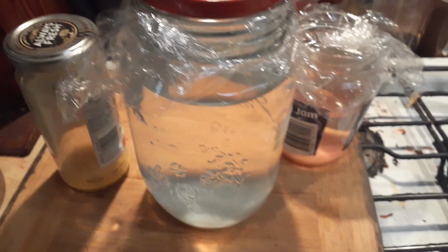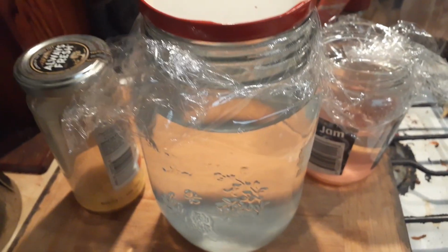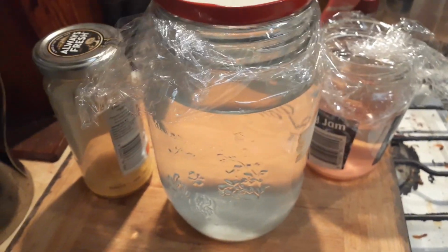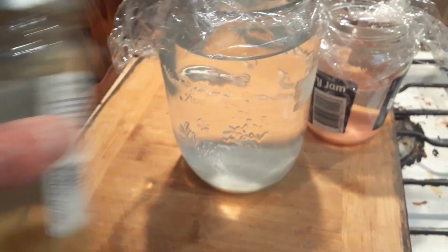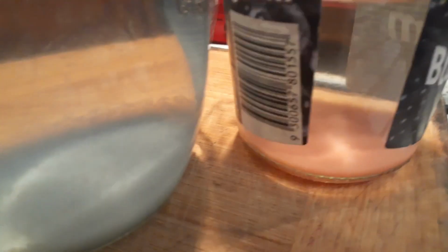So I've been experimenting with colloidal metals, which apparently is like, I believe, the monoatomic form. Either way, you get this interesting kind of powdery, cloudy stuff. As you can see, this one's yellow, it's kind of mixed in with the water now. This one has settled down to the bottom. It's still got an interesting kind of colored water. It's a nice blue color. And this one as well similarly has settled down to the bottom.